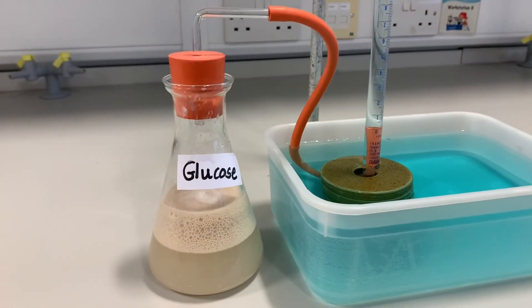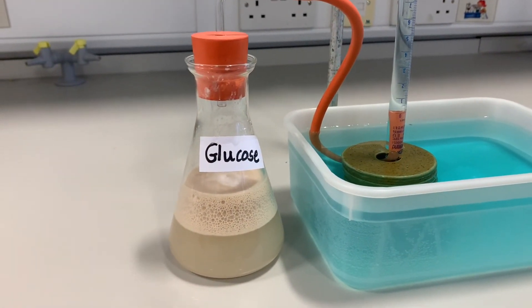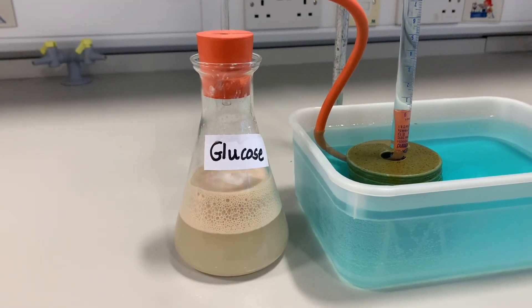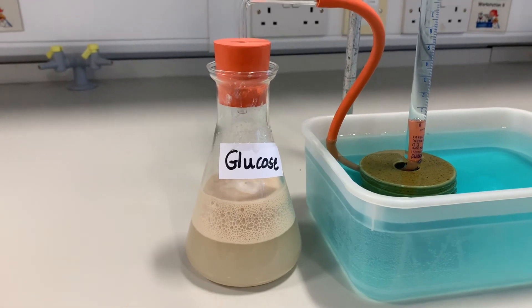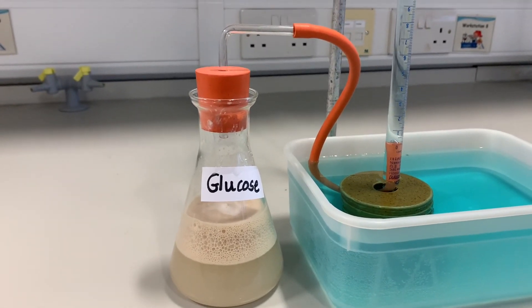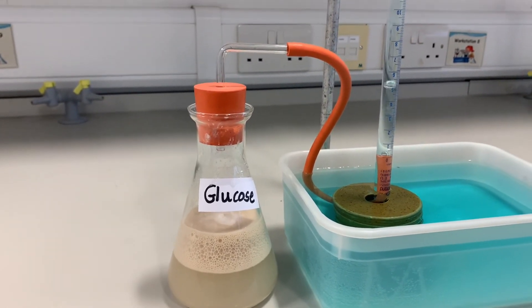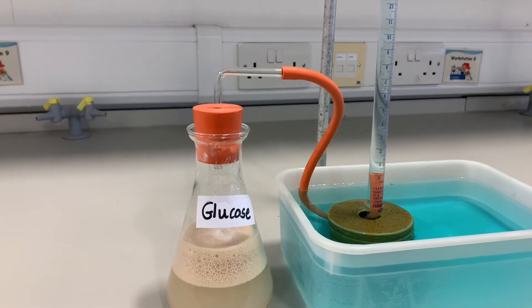As you can see, the yeast is respiring, it's producing carbon dioxide gas, and you can see the bubbles of gas moving up the tube.